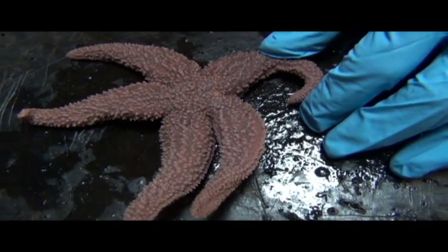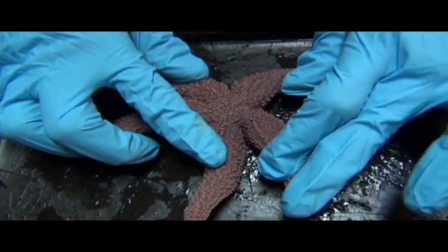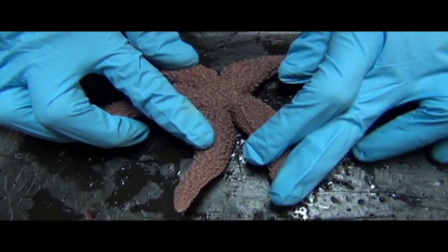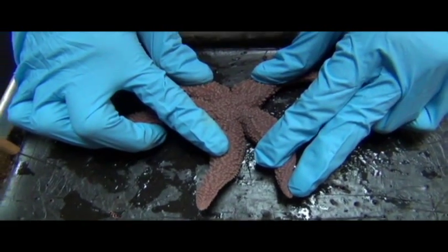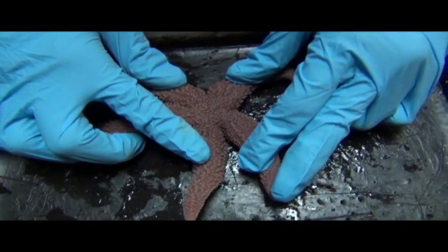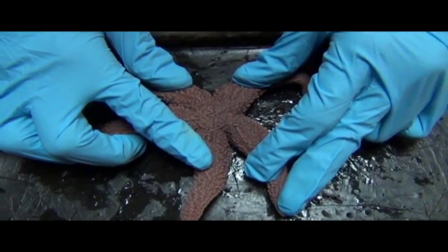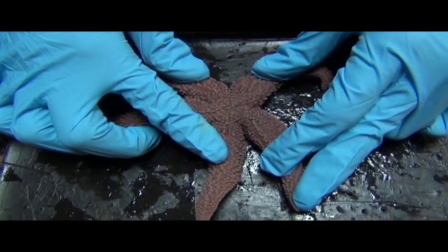A little bit more about the overall structure of this animal. This animal does not have a vertebral column, but it is able to form its body into a sort of rigid stance, and the way they do this is by drawing in water. They have what's called a hydrostatic skeleton. What that means is that they have a skeleton made of water.